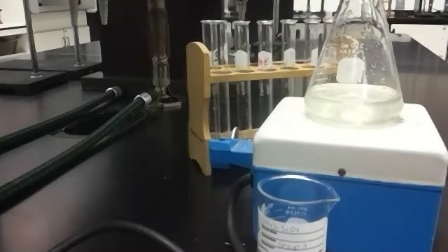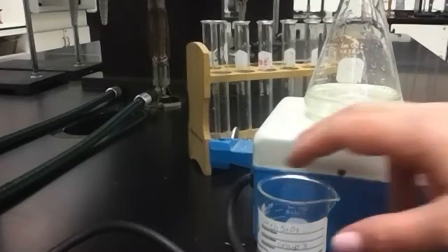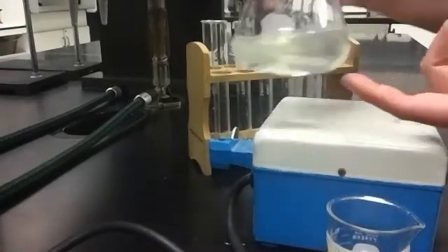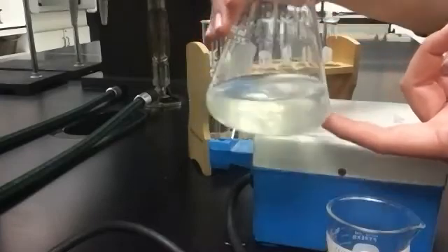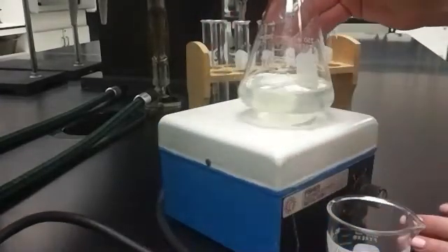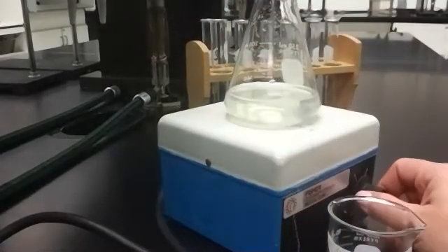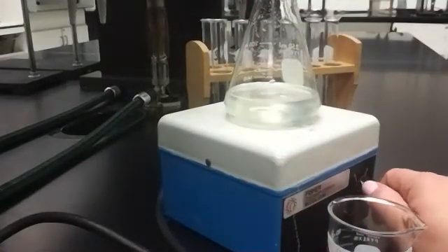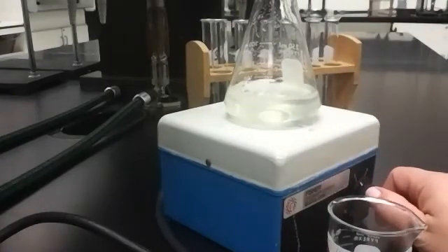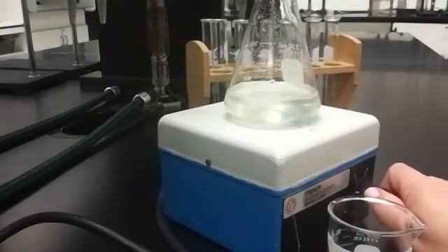So when I mix these things, I'm going to start a timer and the reaction's going to go. The other thing I want to tell you is I have this set up on a stir bar. Like you can see here, there's a little magnet down inside the solution. This looks like a hot plate, but it's really a magnetic stirrer. So when I turn that on, it's going to stir the reaction for me so that I don't have to. I'm going to try to turn that down so it's not so loud.